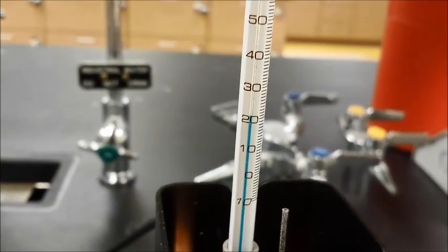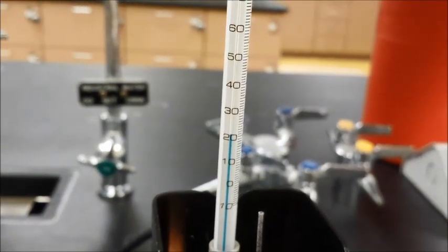And so now looking through the magnifying glass you should be able to tell when it started melting, which means it will be a liquid. And then when it is completely melted it will be a complete liquid at that point. So then all you have to do is watch for the thermometer over here and read the thermometer as you are getting the melting done.